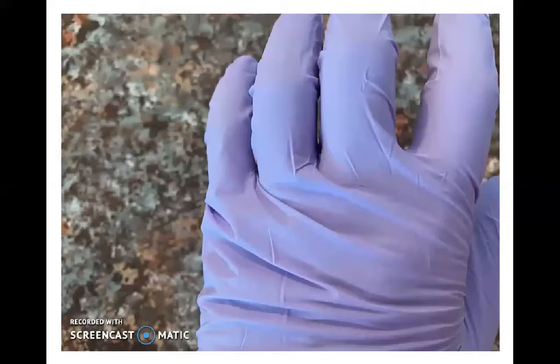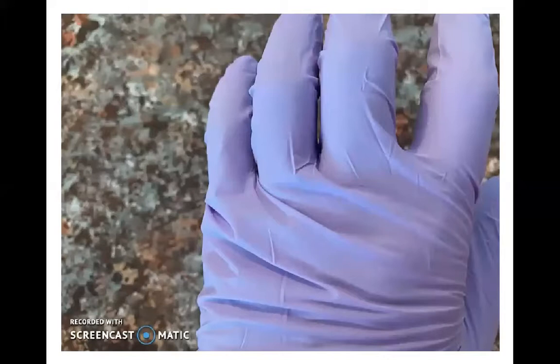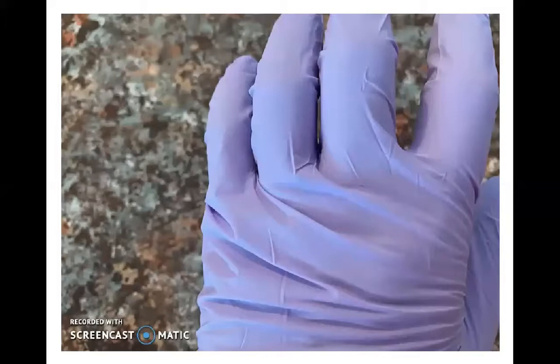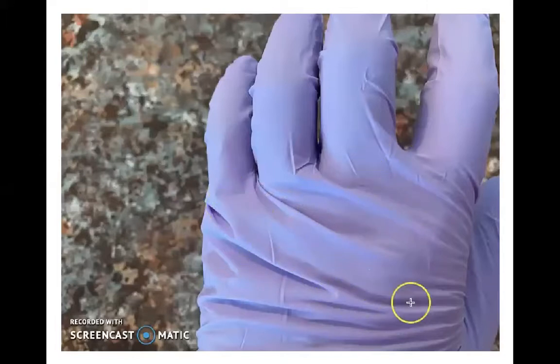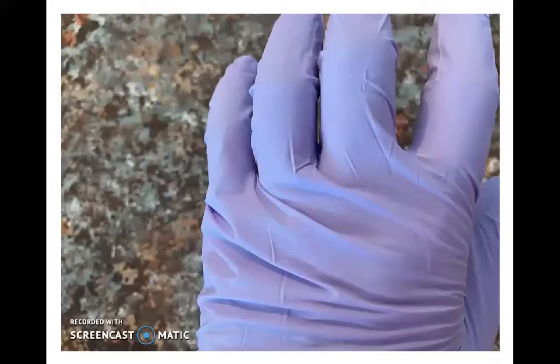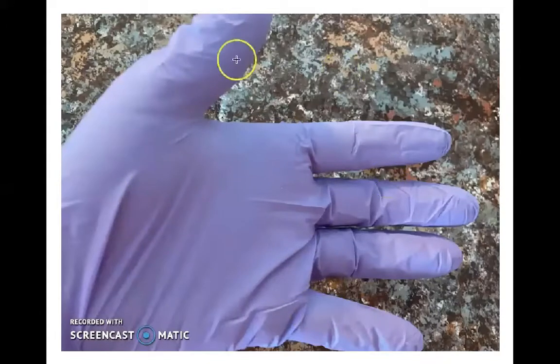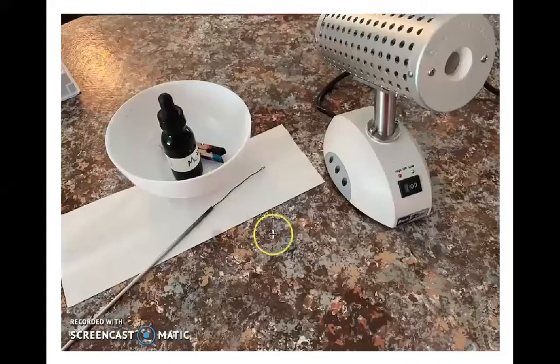These are nitrile gloves. I put this picture in because I want you to see these gloves are a little too big for my hands. You want to wear gloves that are not too tight or too loose — when you look at the back of your hand you should be able to move your fingers and thumb around without very large folds. You don't want the glove to have a lot of extra space but you also don't want to wear a tight glove — it's not good and will cut off your circulation.